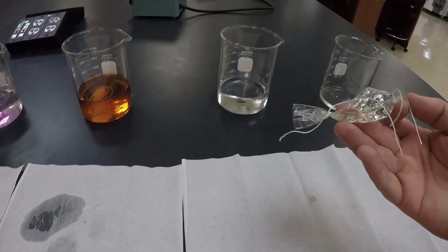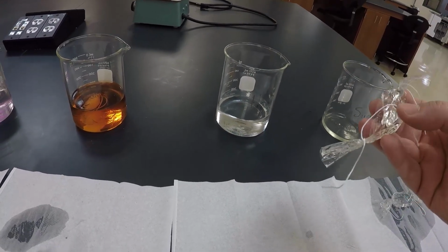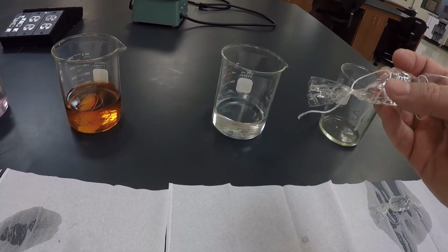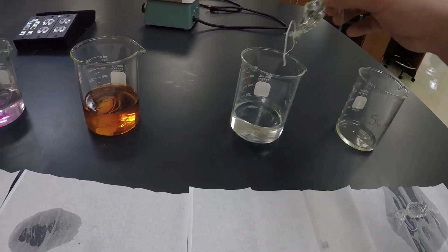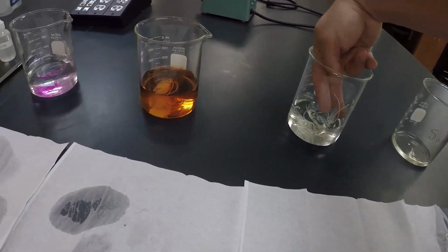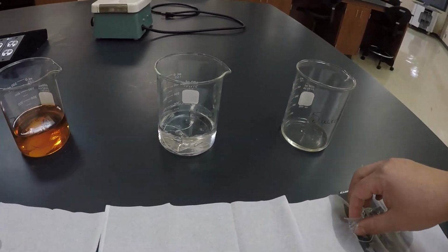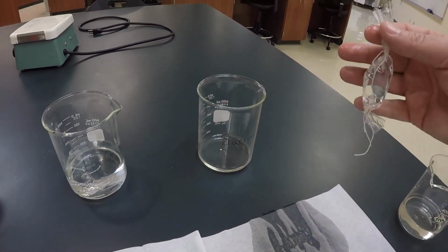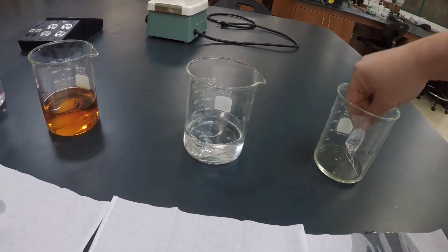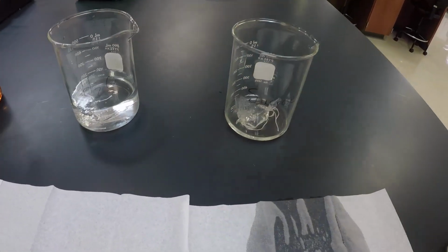And then I have two osmosis setups. This one is sucrose inside a dialysis tubing. Okay, so it's just really corn syrup. And I'm going to toss that into some distilled water. Okay, get it down in there. And then the other one is just a sack of water. Okay, distilled water, and I'm going to toss that onto some sucrose. So there's some corn syrup in the bottom of that.